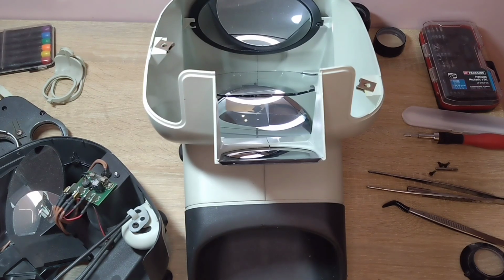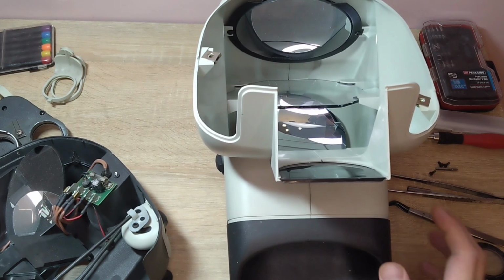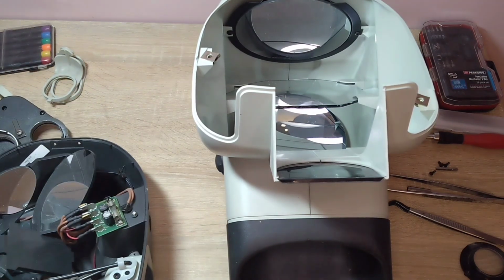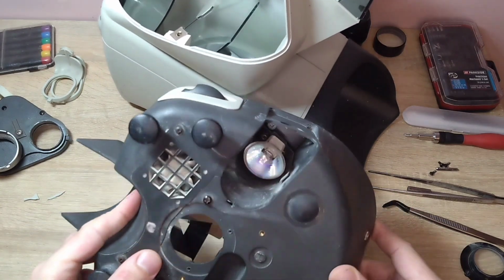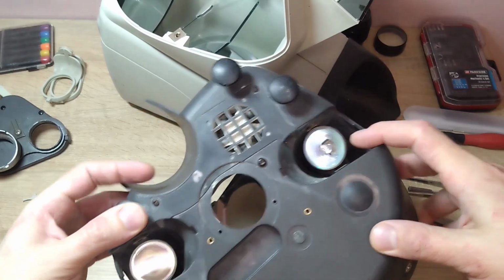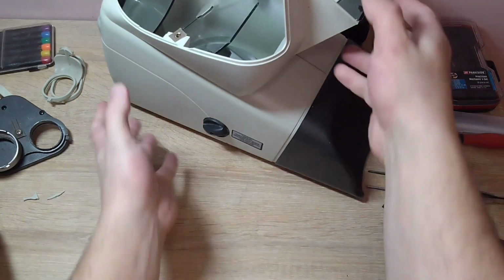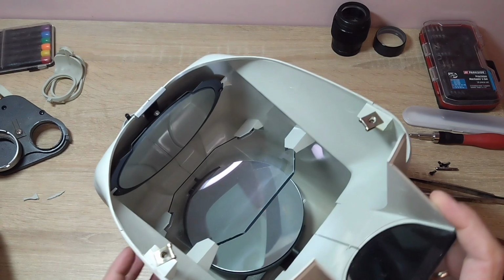As you can see, I have already unscrewed some parts. That is, I have separated the two halves. I have unscrewed many screws, but not all of them that are needed. In general, the screws that need to be unscrewed, if everything fits, are located one behind this spotlight and the other behind this spotlight. Also, there are two in this place. So here a screw was screwed in, and here as well.